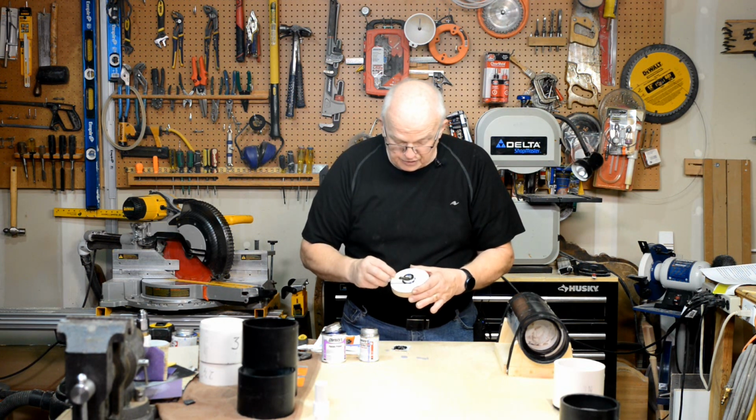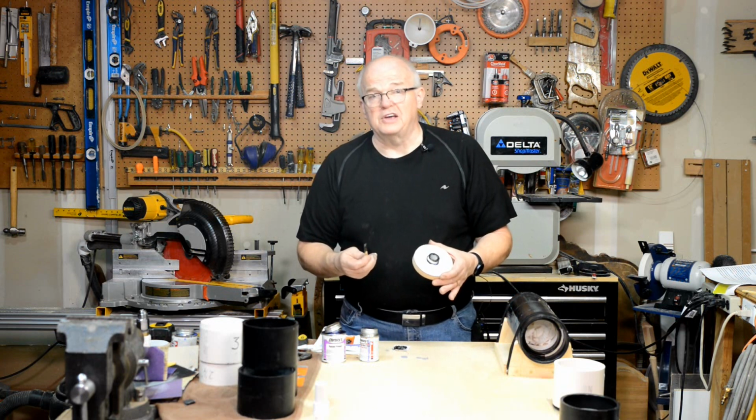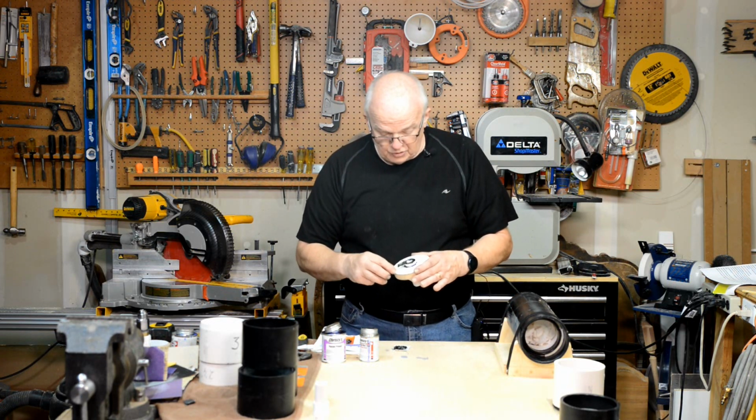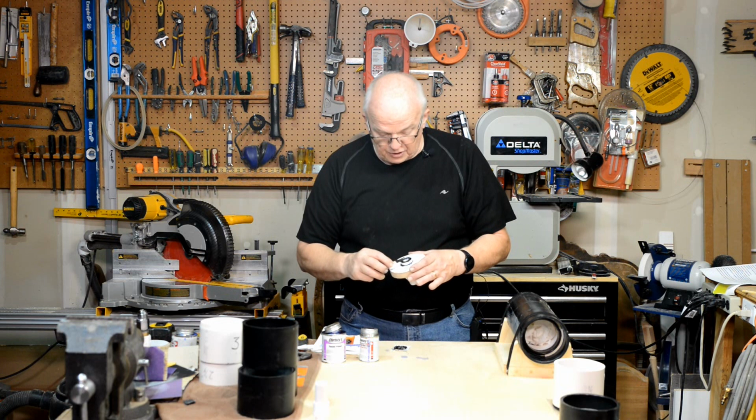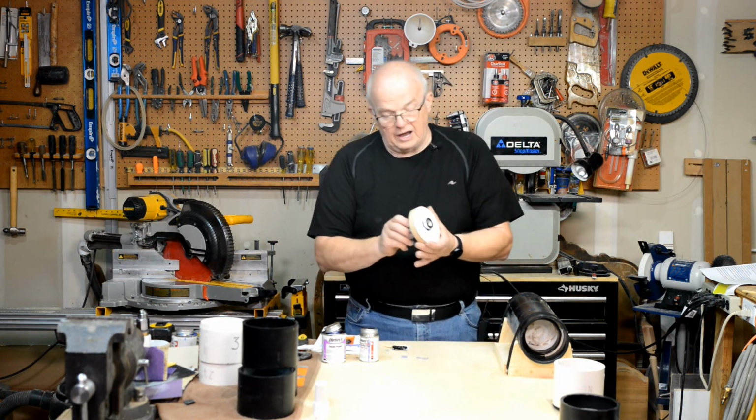And this is important enough that you don't want to have a leak in this. Okay, because if this leaks, well, number one, it's going to be difficult to find out where it's leaking from. And number two, once you do find out where it's leaking from, you'll have to put more epoxy on it. So it's just better if you do it to begin with. So there you have it.